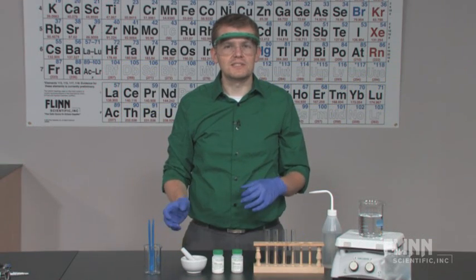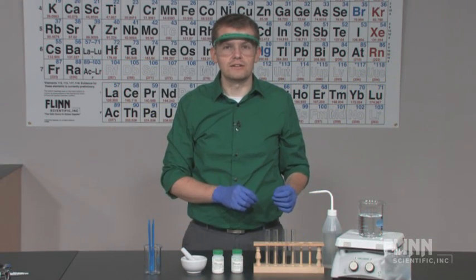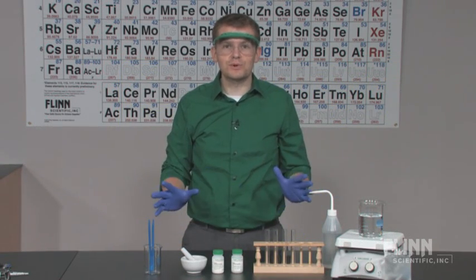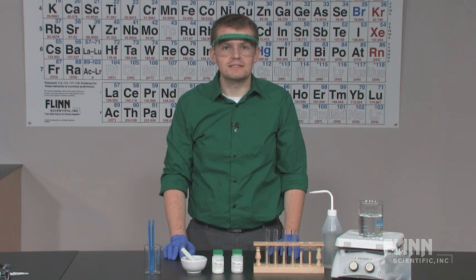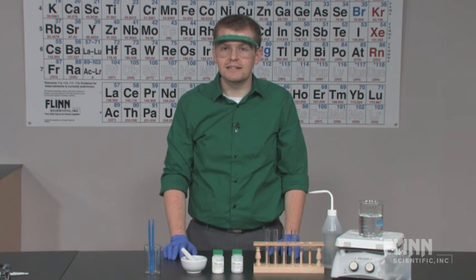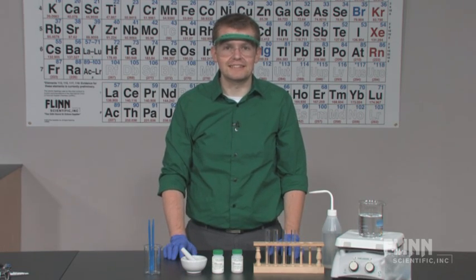Why is it that some solids take longer to dissolve than others? Explore this phenomenon with the Factors Affecting Solubility Guided Inquiry Kit from Flinn Scientific.